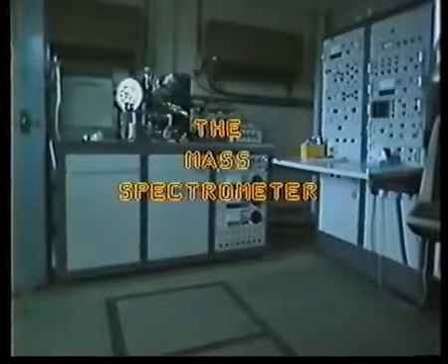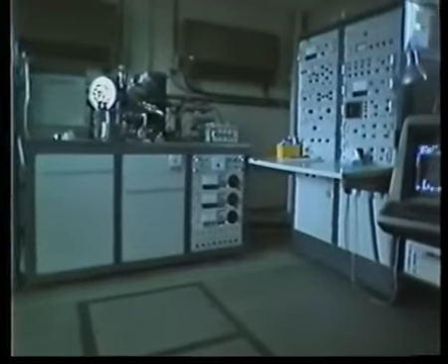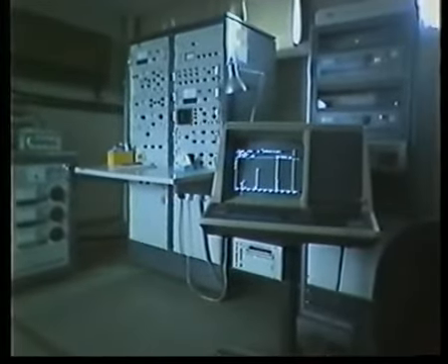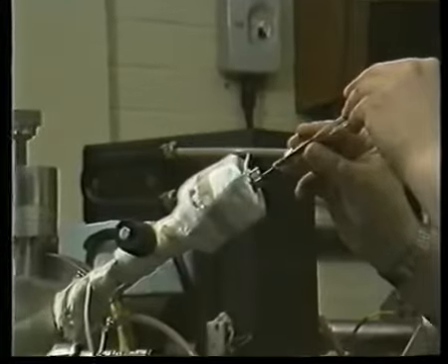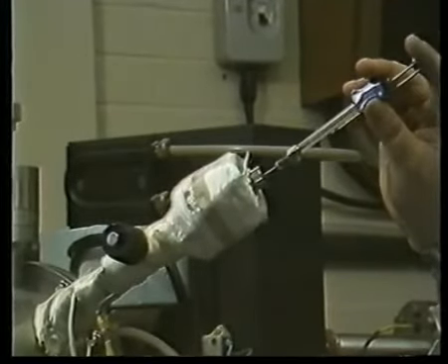A mass spectrometer is able to analyze substances into their component parts. Here on the left is a mass spectrometer with all the associated equipment used to analyze the output here on the right. This syringe is being used to introduce a sample which needs to be analyzed. This particular sample is an organic liquid.